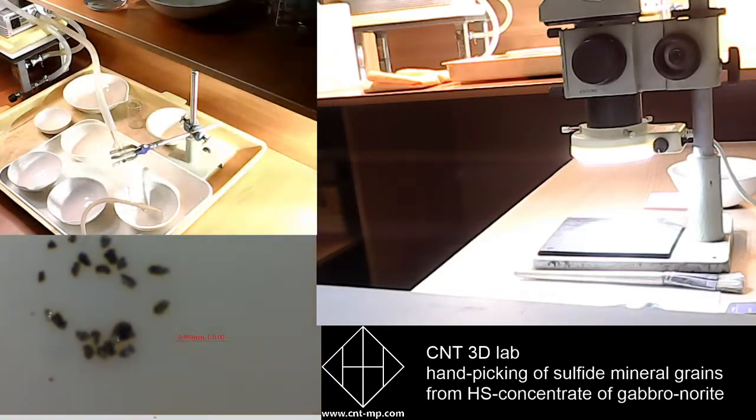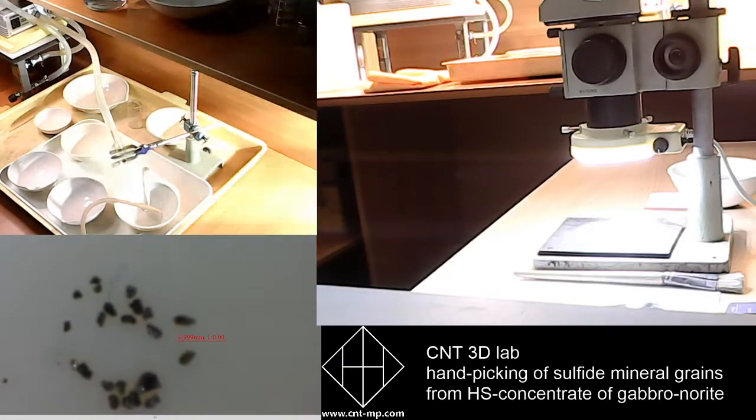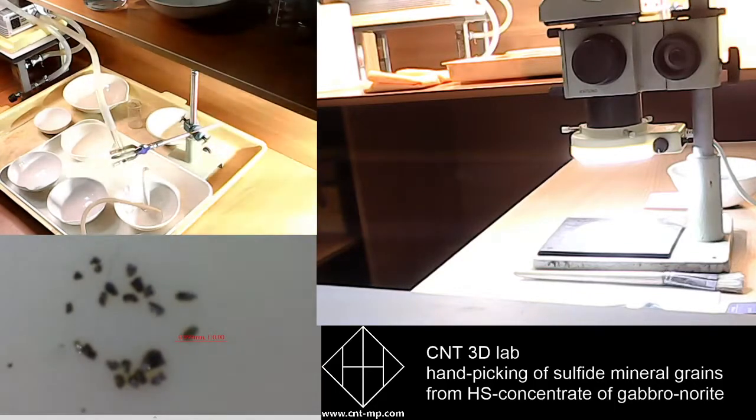Okay, so these are the grains I have collected by hand picking. It is not so difficult as it looks like, but you really have to be patient, accurate, and have very good eyes.